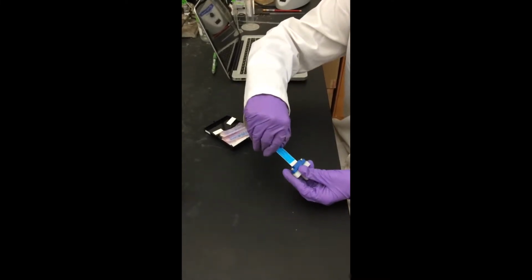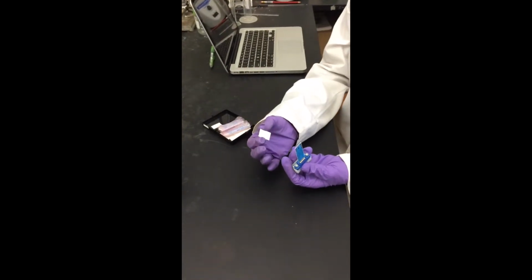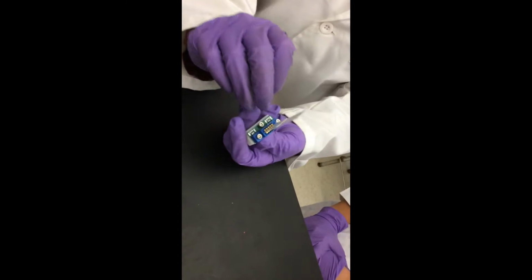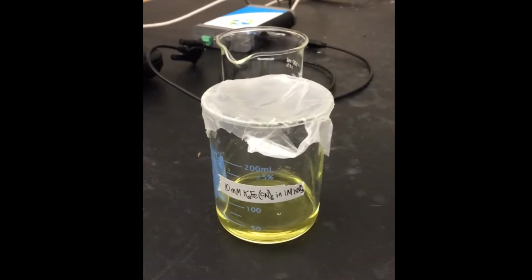When inserting the electrode into the cell adapter, it is important to insert the white section first so as to have the black print immersed in the analyte solution. We then use a small segment of stiff paper to mount the electrode by inserting it on the non-colored side of the electrode into the cell adapter.